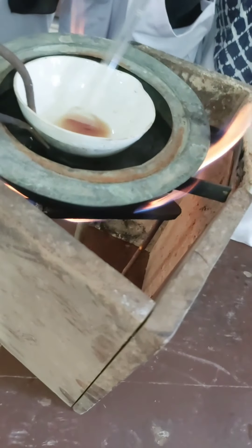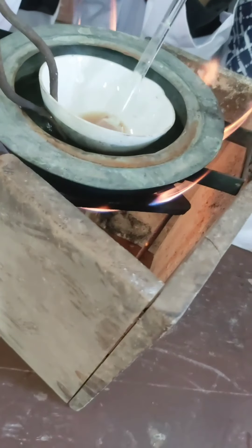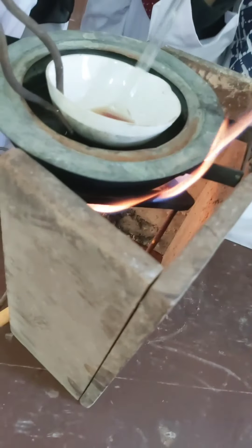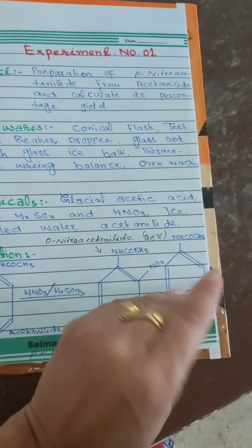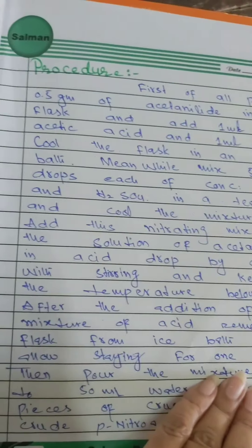The reaction mixture will hopefully soon turn into crystals. They will cool it in ice-cold water, keep it until it crystallizes, and then move on with further steps. This is the chemistry practical journal — I wanted to show you how they are going to write the experiment. They missed the date here, but this is how it is supposed to be written; the left side is for the reaction.